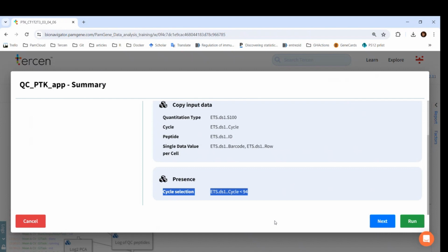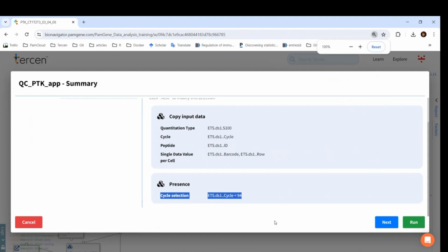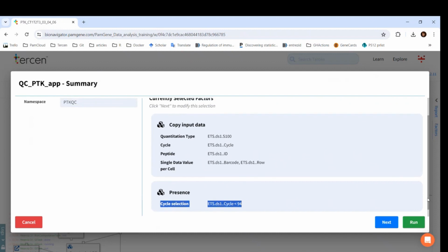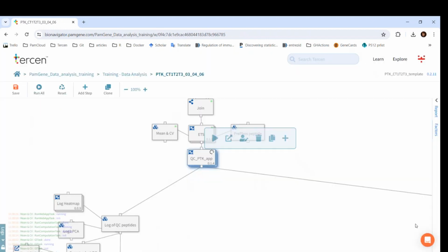If the experiment run has been stopped, then the cycle numbers would change. You have seen how to adjust filters in this case in the image analysis workflow. In the data analysis, you have to do the same in this step, to just replace 94 with the number of the last cycle in your data. Let's run the step.